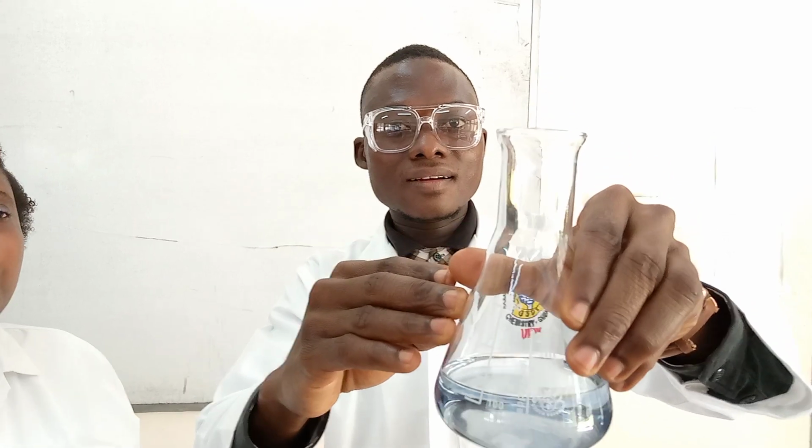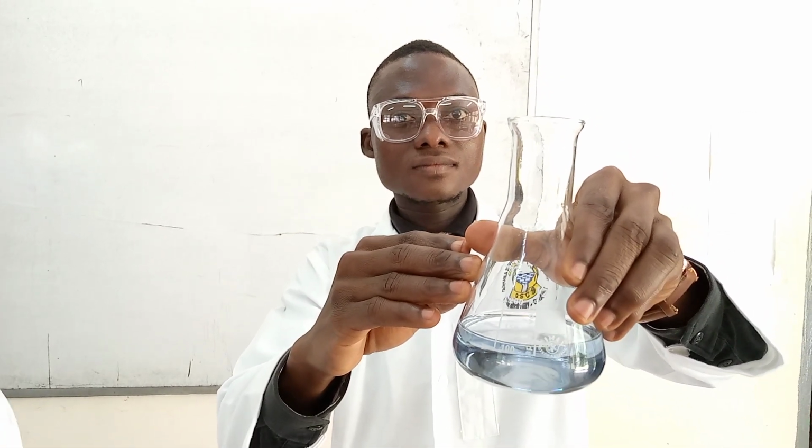Yes. So at this point, it means that all the metal ions that formed a complex with the indicator have been taken away by the EDTA. So now the indicator is free from metal ions, so it has returned to the initial color, which is blue. Yes, so that's the end.